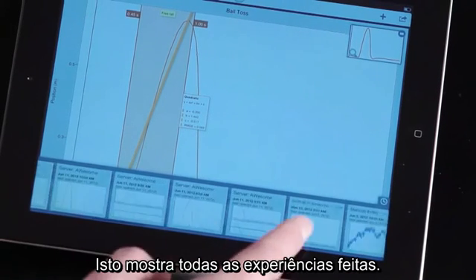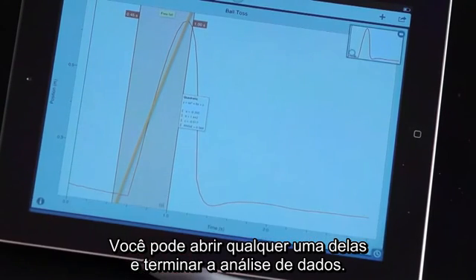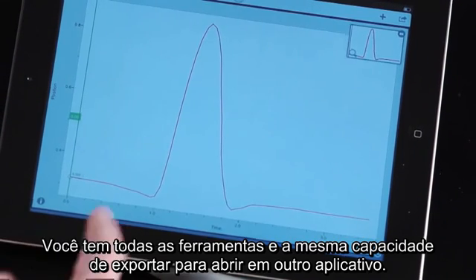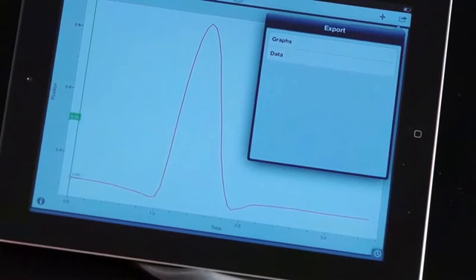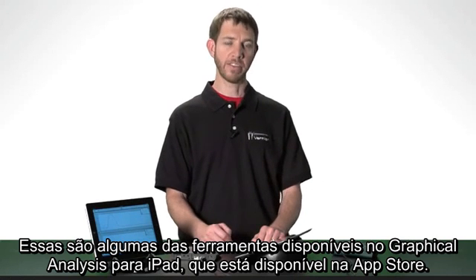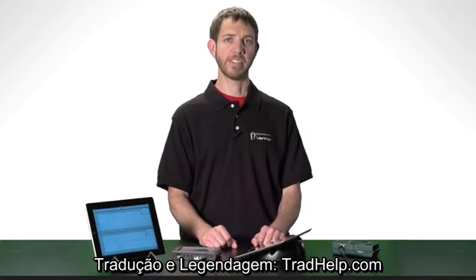This will show you all the experiments that you've taken. And you can pull up any of them and finish your data analysis, and you still have the same tools and the same ability to export or to open it in another app. These are some of the features available in Graphical Analysis for iPad. It's available now in the App Store, and we're looking forward to seeing what you can do with it.